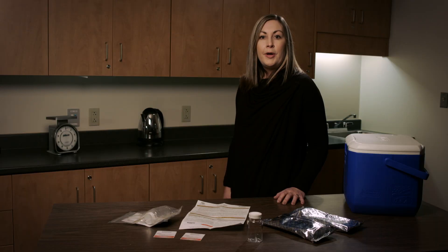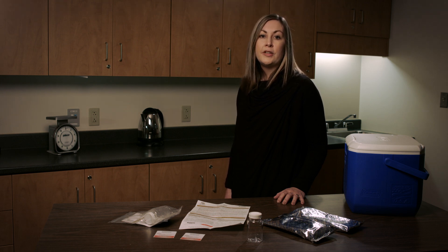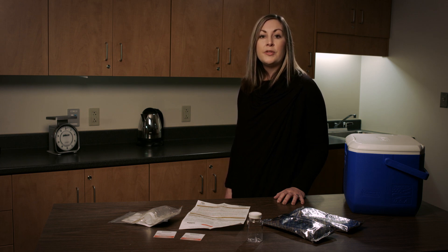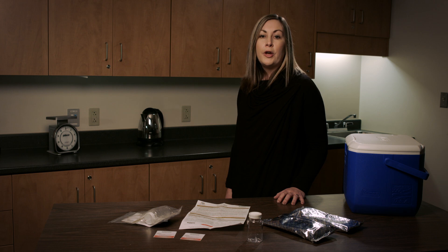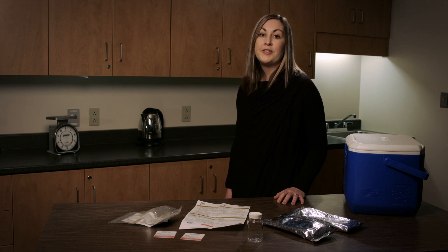For the majority of public drinking water systems, representatives from ServiceNL collect the required bacteriological samples. However, there are instances when community representatives are asked to collect the sample on behalf of ServiceNL. Also, many homeowners collect bacteriological samples from their private drinking water supplies, such as drilled wells. To ensure that the samples are representative of the quality of water delivered through your faucet, these sample collection procedures are to be followed. By following these instructions, you will be ensuring that the samples will not be contaminated during sample collection.